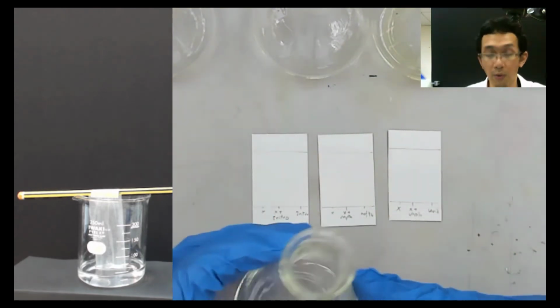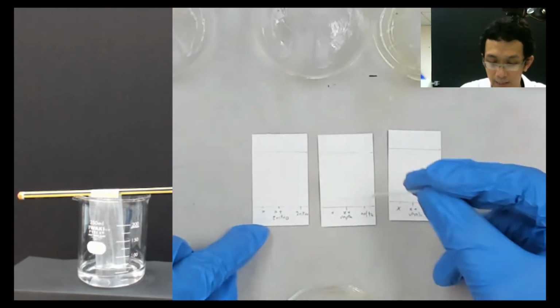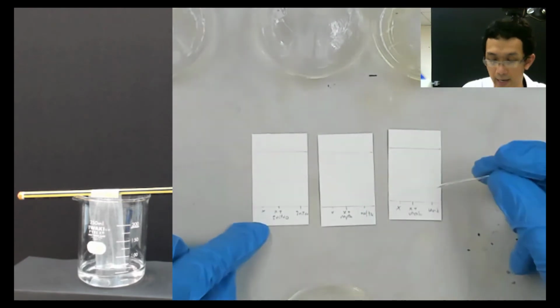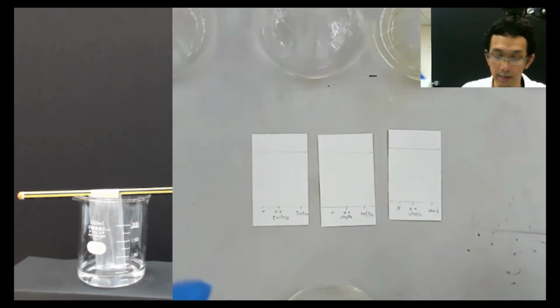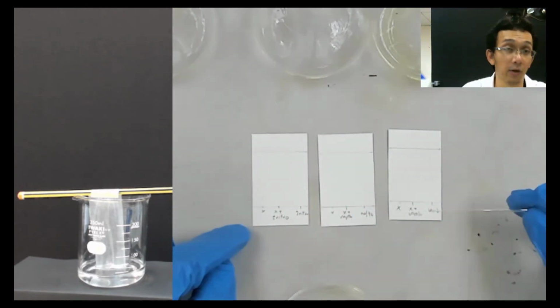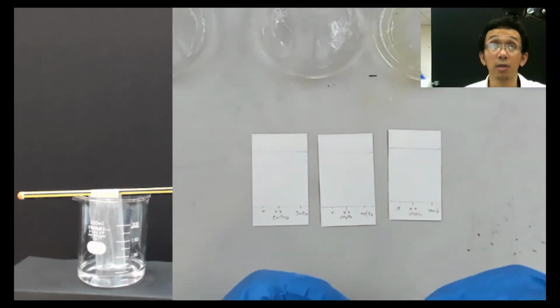One tip when you do this: because you know this X, this X, this X, you can do them straight away. You can do X, X, X straight away. You don't need to do them again and again, and you don't need to finish this first before the next one. You can do all the X straight away. So that's what I will do.